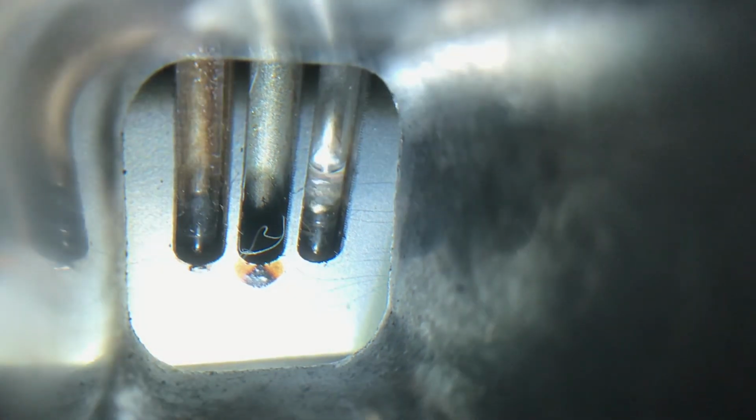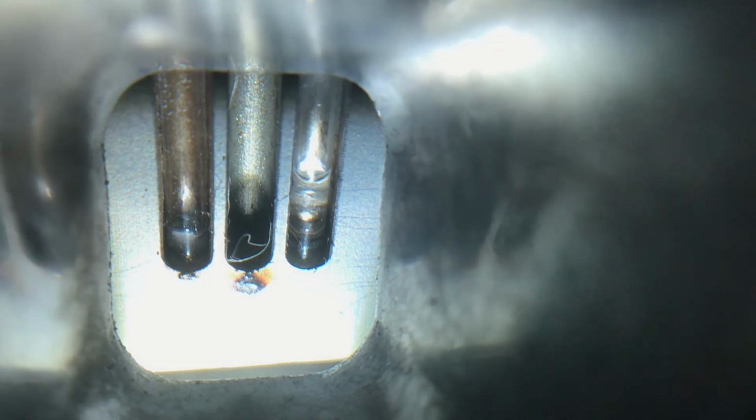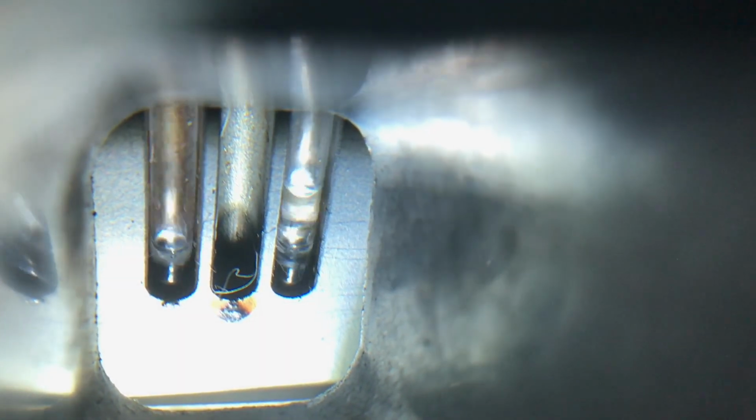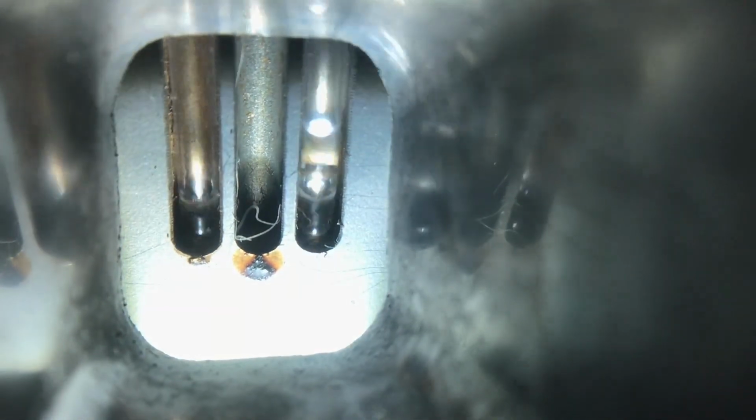And knock it down. Sometimes an air bubble just collects, but it doesn't. Okay, it looks like they're both all gone at 136. So the TCI sample actually happened over a little bit broader of a range. I think that's just an air bubble on the right one. But they're both liquid.